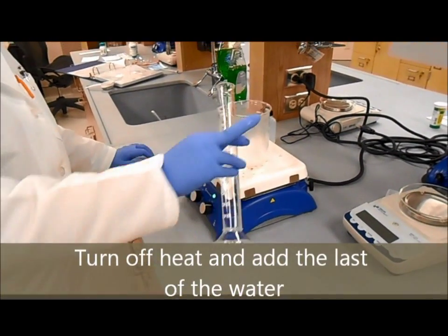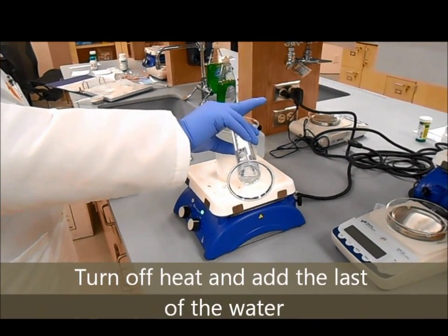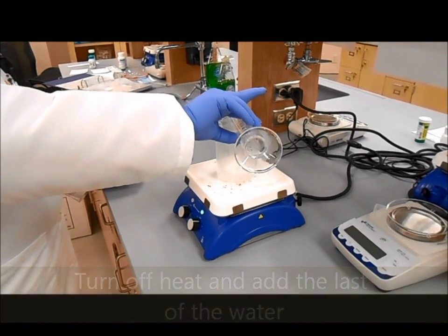Allow it to mix for 30 seconds, then turn off the heat and add the last of the water while it's still stirring.